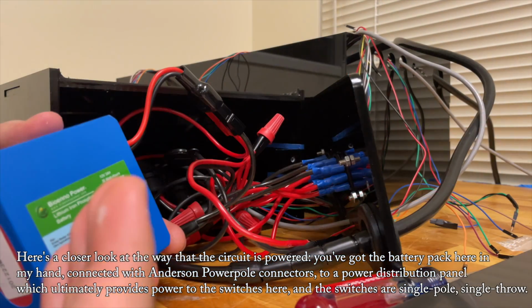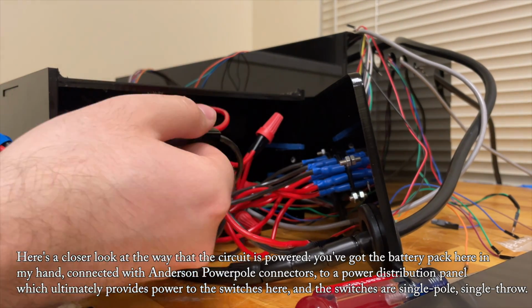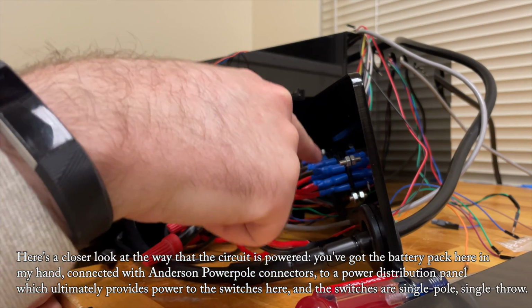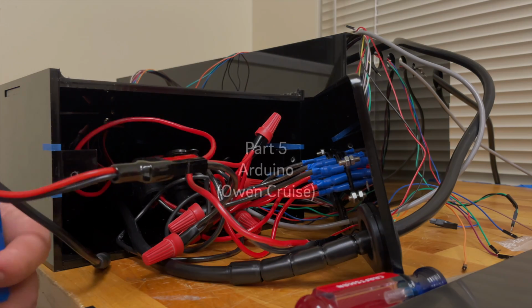Here's a closer look at the way that the circuit is powered. You've got the battery pack here in my hand connected with Anderson power pole connectors to a power distribution panel, which ultimately provides power to the switches here, and the switches are single pole, single throw.